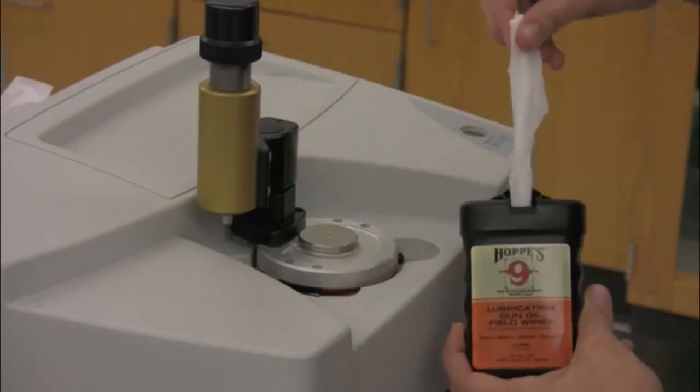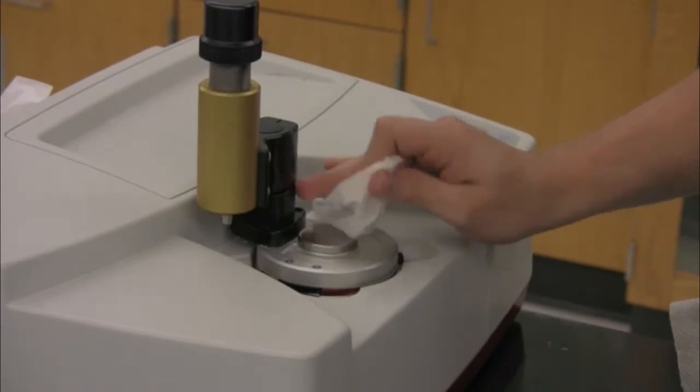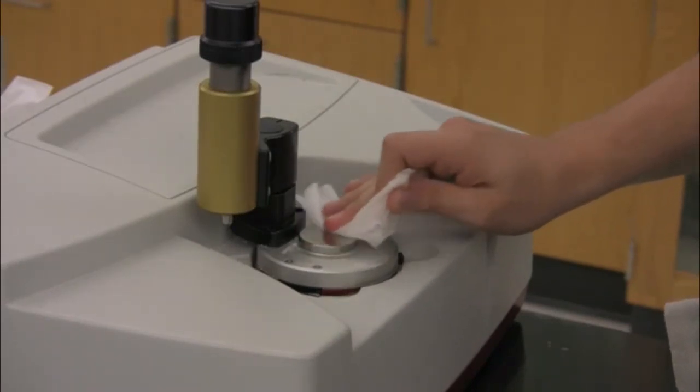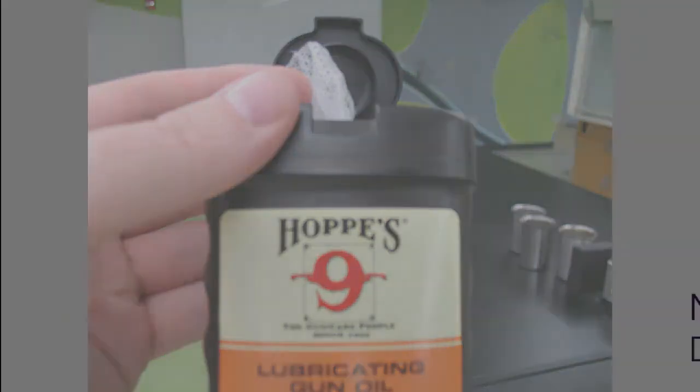If a diamond is hard to clean and it has material stuck on it, and you've tried with a Kimwipe and you've tried with a microspatula like an ice scraper, then you want to go find a TA. We do have special Kimwipes in the lab that the TAs can use that have an oil on them that will dissolve materials that are stuck to the diamond. But only the TAs can use these special cloths to clean the diamond. So once the diamond is clean and your IR spectrum has been cleared from the window, don't forget to take your USB key with you, and we're ready to have the next person go on.